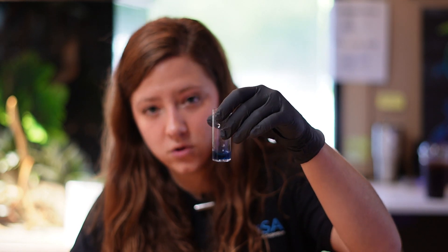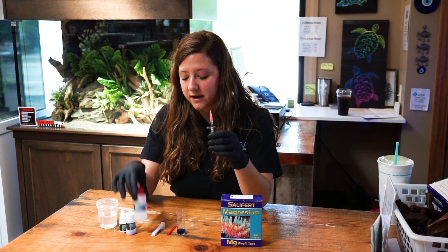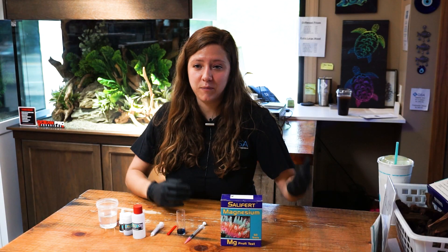So this is what you're going to be left with at the end of the test — the waste from your titration and the waste reagent inside your syringe. I would not recommend putting this back into the reagent bottle, as you can get contamination from inside the syringe. Just keep the reagent bottle pure by not adding any of that back in. When cleaning up after doing this test, make sure you dispose of these chemicals in a proper way that complies with all local laws and enforcement.